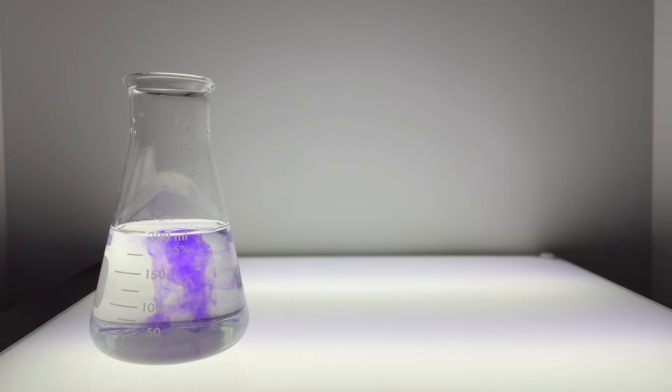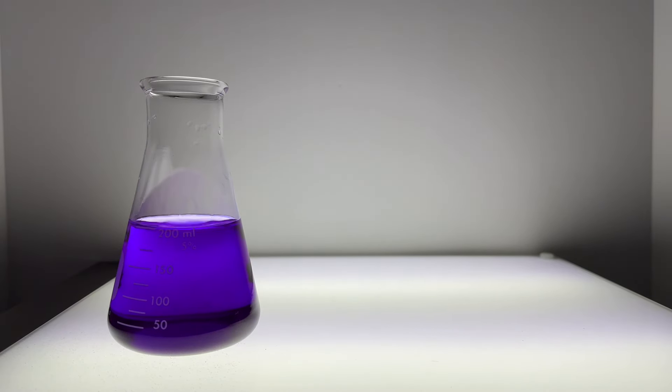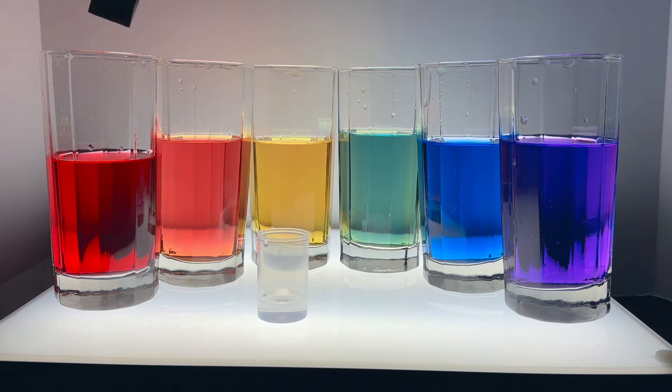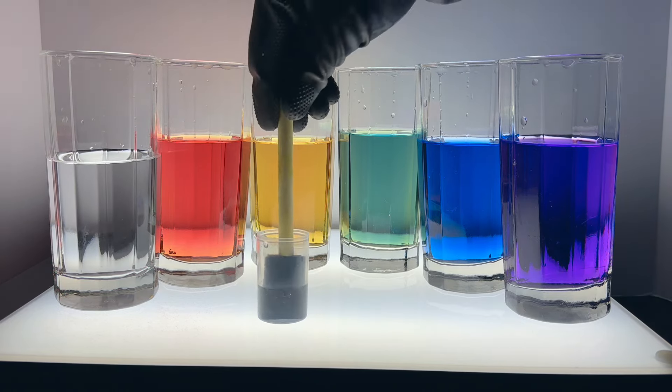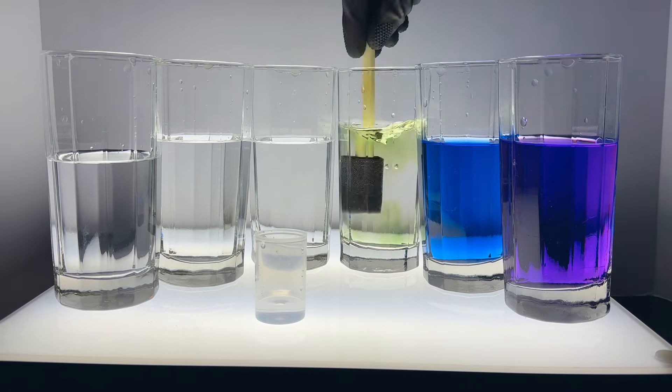In the video description, you'll find recipes on how to generate all the colors for this experiment. Because all of these indicators and mixtures of these indicators go colorless in the presence of acid, a foam paintbrush dipped in acid can act kind of like a chemical eraser.